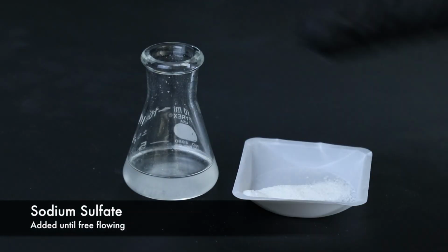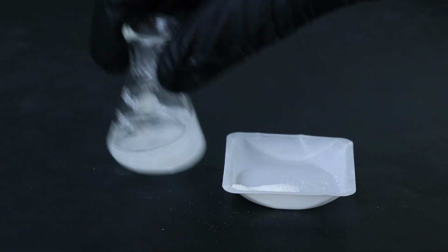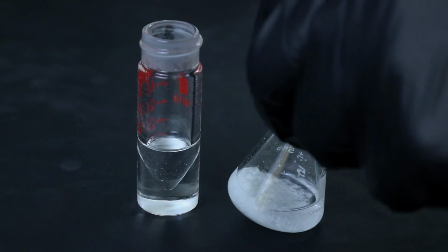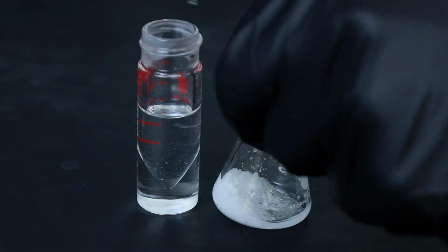Once the extractions are completed, I'll dry the methylene chloride solution with some sodium sulfate, adding it until it's free-flowing. Then I'll remove the solution from the sodium sulfate and rinse it once with some additional methylene chloride to reclaim more product that might have been left behind.